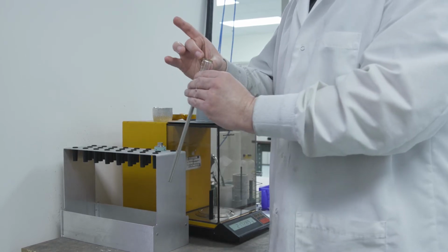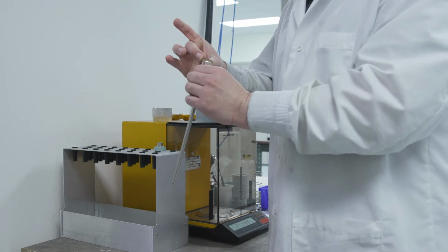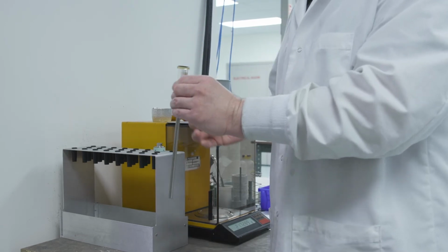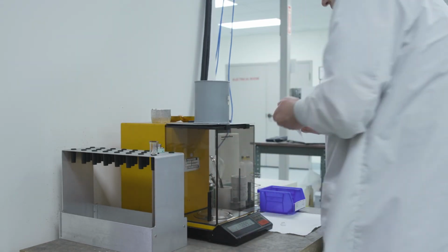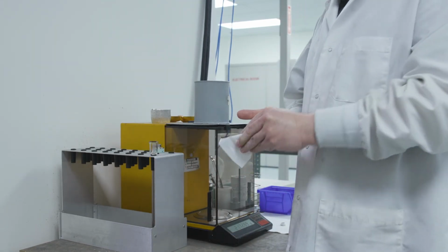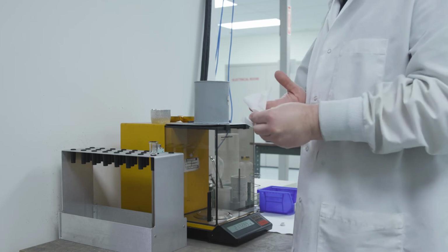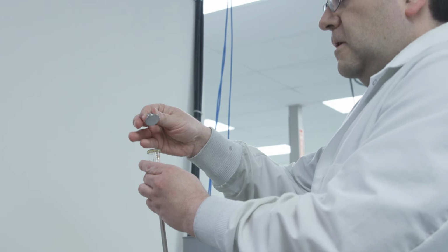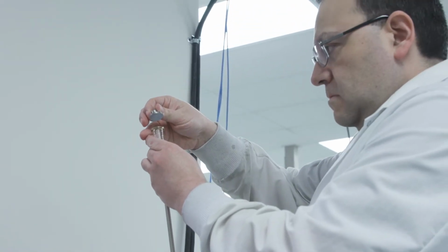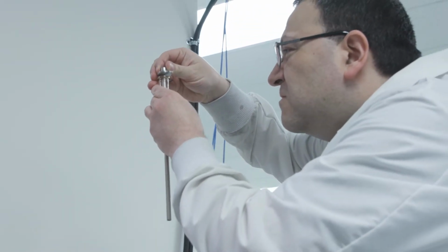He removes any excess grease from the outer edge of the penetrometer and from his finger, and then applies the cap, being careful to align it to the top of the sealing surface.